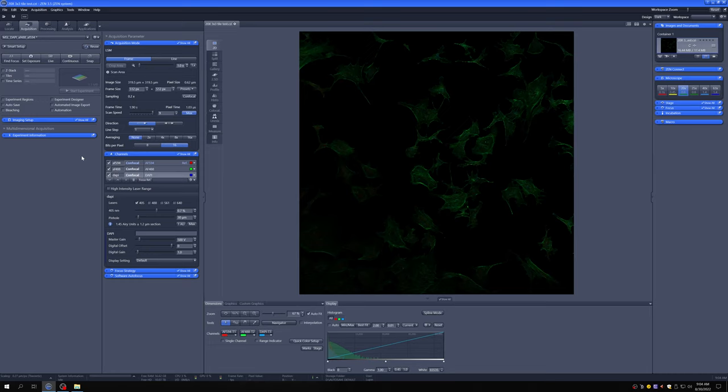If it's too small, you get great optical sectioning, but at a certain point, you get so little light that you can't do anything useful with it. So between those two extremes, there's an ideal pinhole setting. And what we recommend for that ideal setting is to go to your longest wavelength fluorophore. In this case, that's AlexaFluor 594. So we're going to click on AlexaFluor 594 and then adjust the pinhole size so that it is one airy unit. I'll explain what that means in a moment.